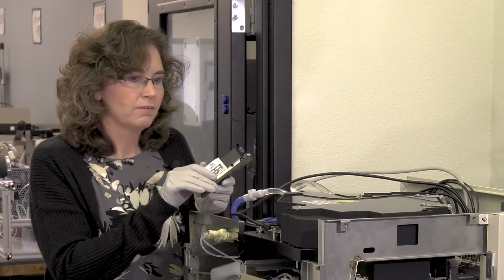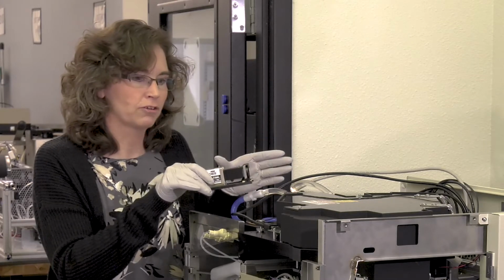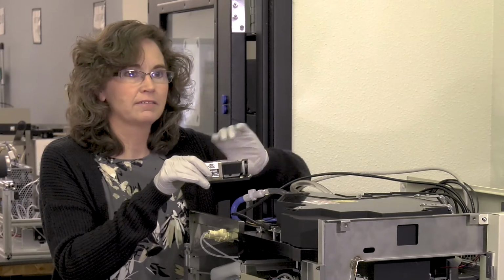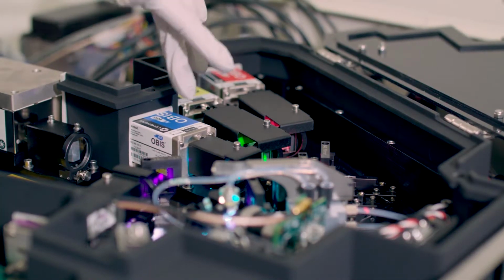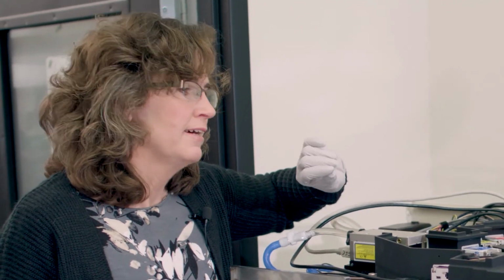We did luckily have the planets align in several ways to be able to get to the small form factor. And by being small, all the path lengths are shorter, and therefore if there is a tiny amount of angular drift, it's less to see at the flow cell. The 5 lasers are fitting all within the footprint of this upper plate, and every angle is tuned to get maximum density and separation, and to try not to have too many things coupled together, so that if one laser needs to be adjusted, you are just adjusting that one laser. That makes it easier to use, quicker to assemble, and quicker to service. So yeah, the top is pretty impressive.